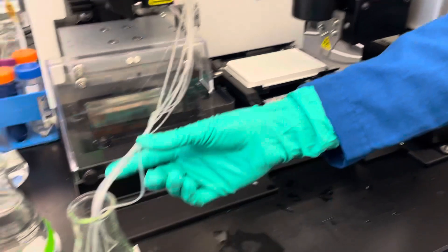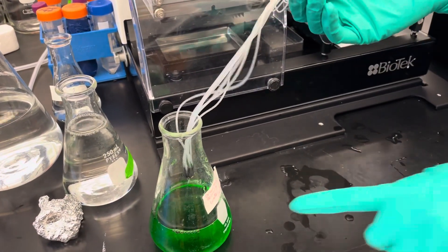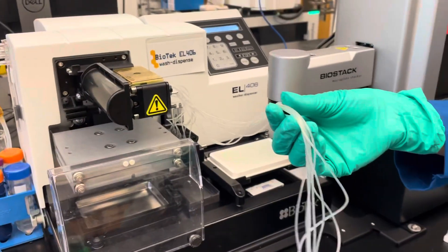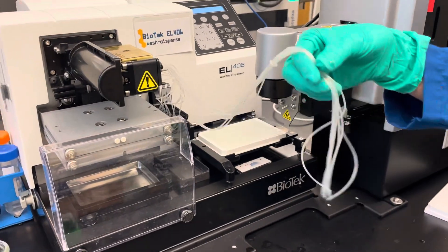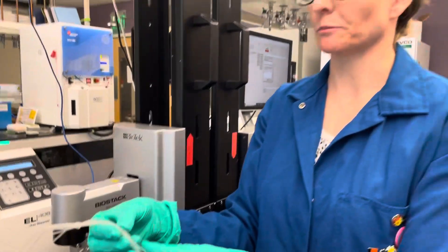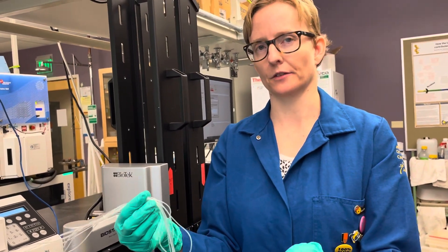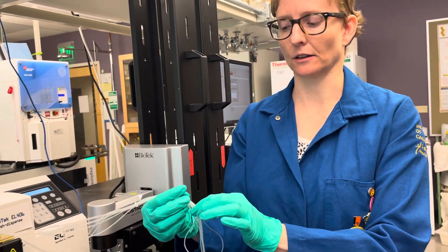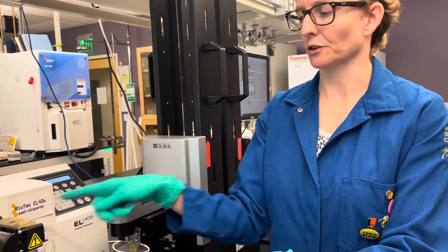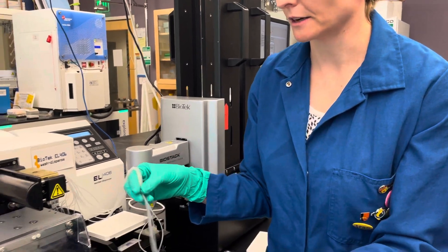This protocol has a purge programmed in. Just let all of the dye that was in the tubes come out — that's kind of a dead volume, so it helps to recover those. That's especially useful if you're using this to dispense precious liquids. We usually use the one microliter for precious things since it's got the smallest tube and therefore the smallest dead volume, so you're wasting less of your liquid, but you can recover the liquid that was unused.